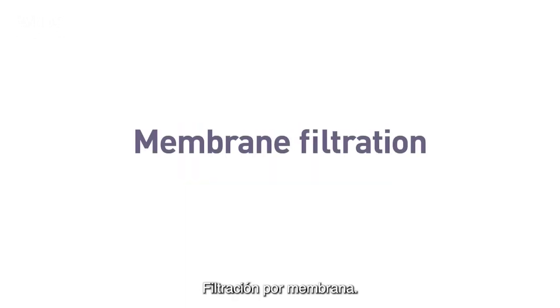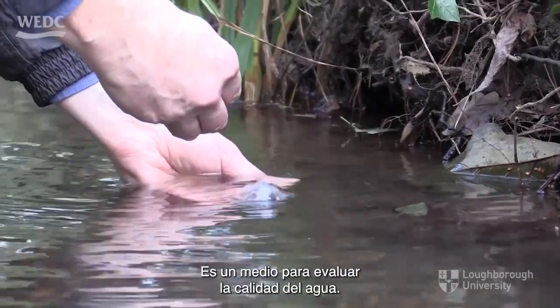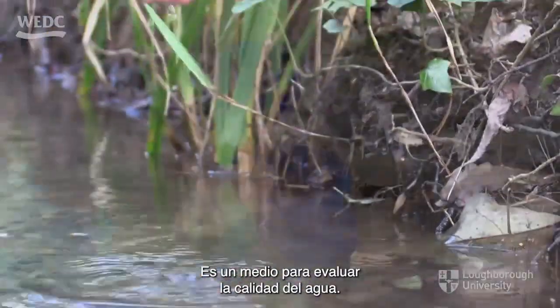Membrane filtration. Membrane filtration is a means of testing the quality of water.